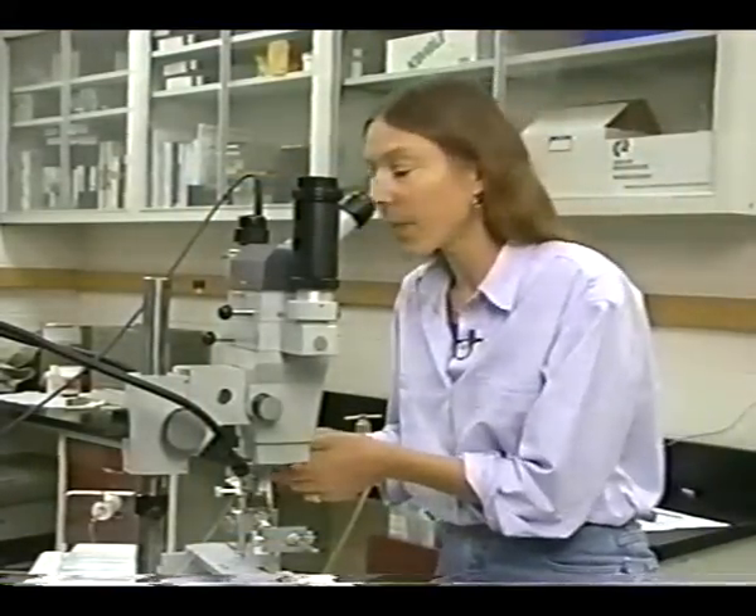Now that we've taken a look at the diagram, we're going to move to the microscope. The tip is used to bypass the valve fold. Bring this straight down, staying close to the sting. You're going to go about a half a millimeter deep, lift up slightly, and go another half a millimeter.